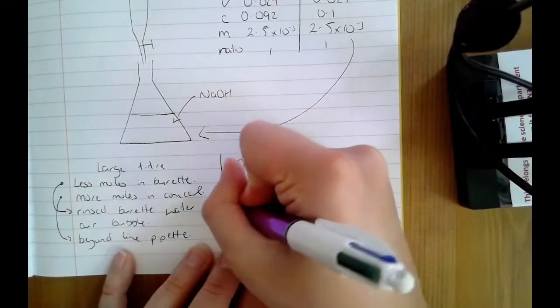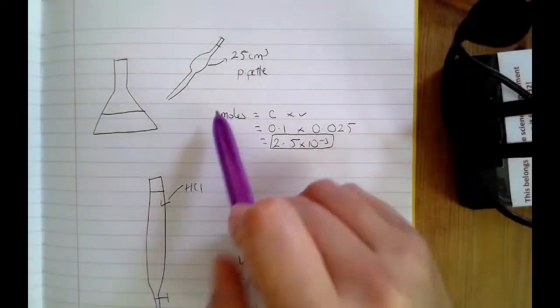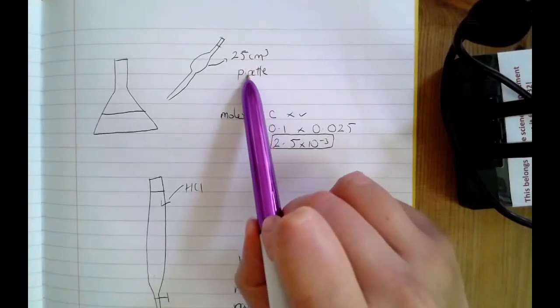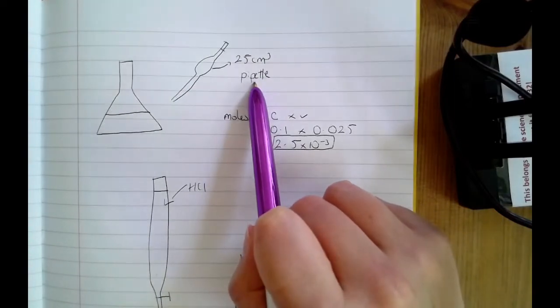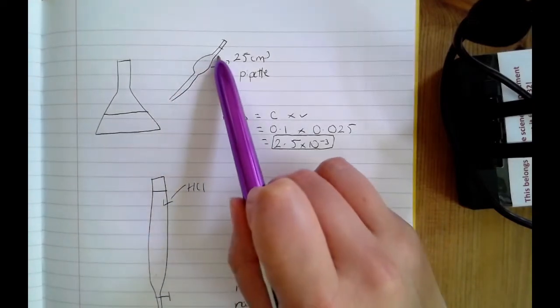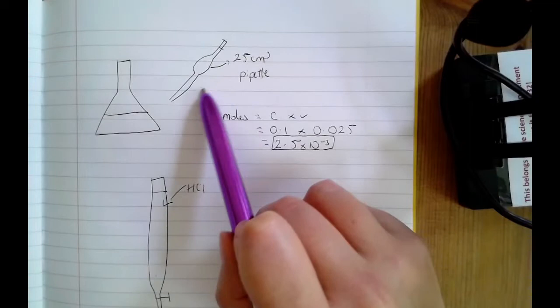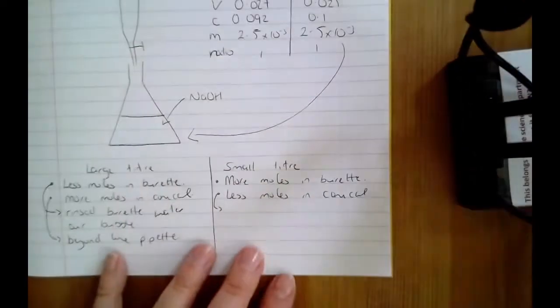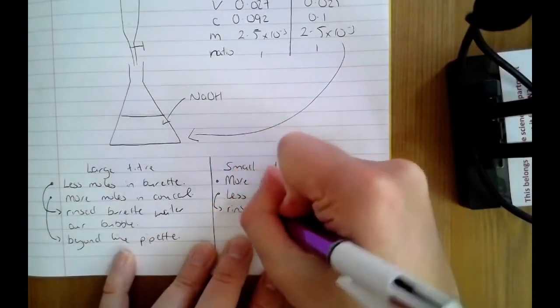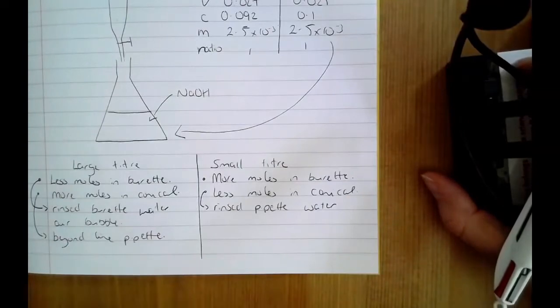But this one here is the most relevant, the less moles in the conical flask. This one comes up quite a bit. If we look up here, less moles in your conical flask, in order to have the correct number of moles in your conical flask, you have to use your pipette properly. Just like the burette that we talked about before, it's okay to rinse your pipette with water first, but then you have to rinse it with the solution it's about to contain. If you've got your pipette with lots of droplets of water in there, and then you try and measure out 25 centimetres cubed, that water that remains in the pipette is just going to dilute your alkali or your acid, and you're not going to end up transferring the correct number of moles to your conical flask. So again, if you've rinsed your pipette with water, that is going to mean you're transferring less moles than you want to the conical flask.